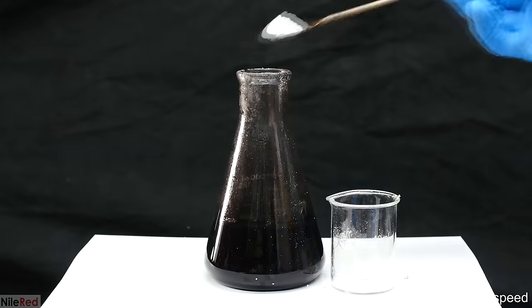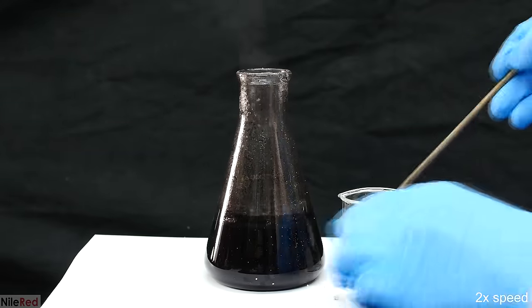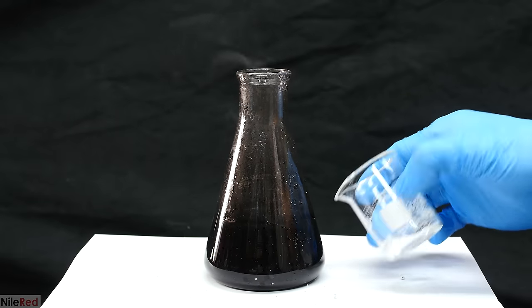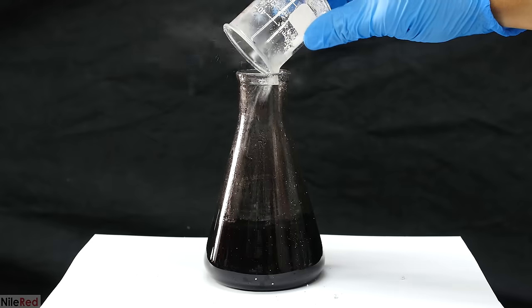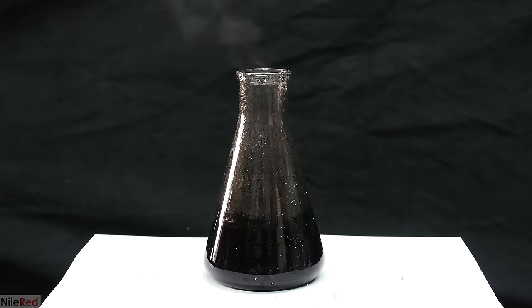As we continue to add more sodium borohydride, each addition becomes less and less vigorous. Because of this, we can start to add much larger portions, and we don't have to fear some crazy violent reaction. Once I've finished adding all of the sodium borohydride, I continue to stir the solution for about 20 minutes.